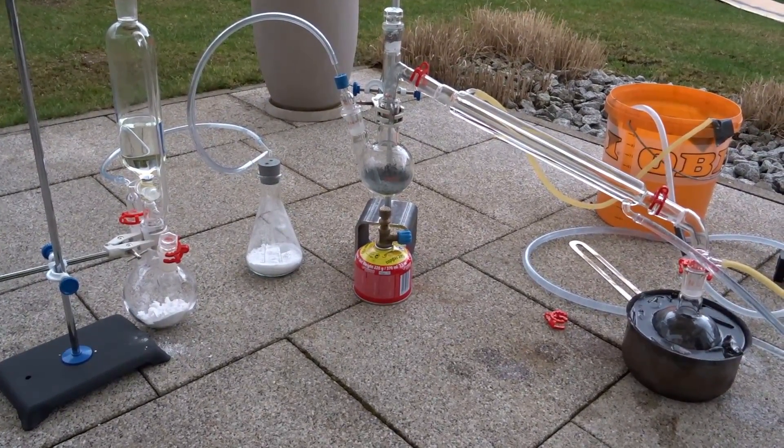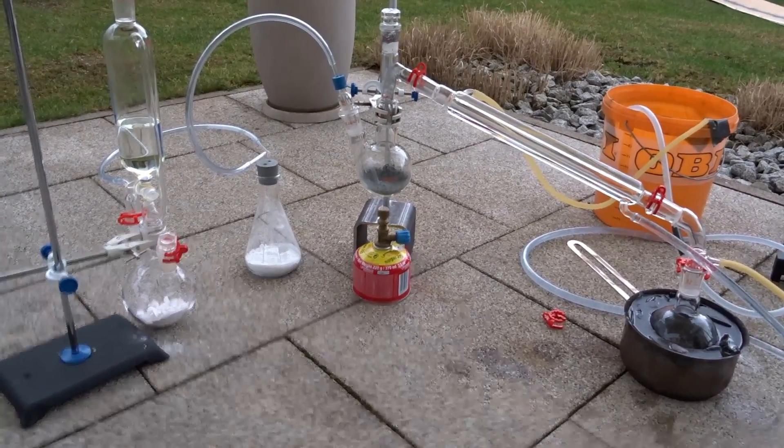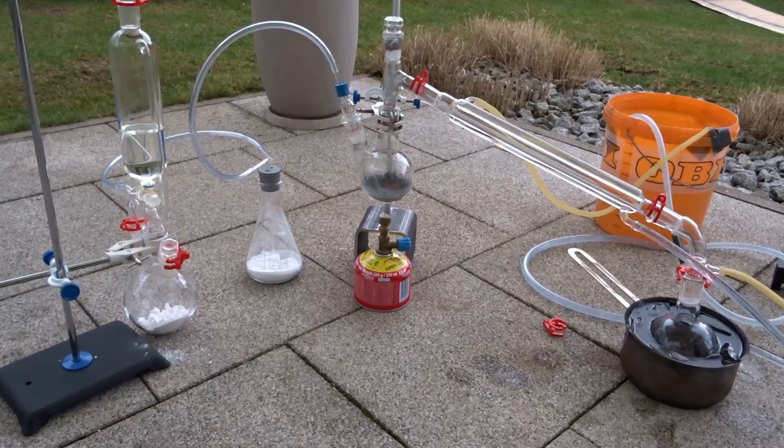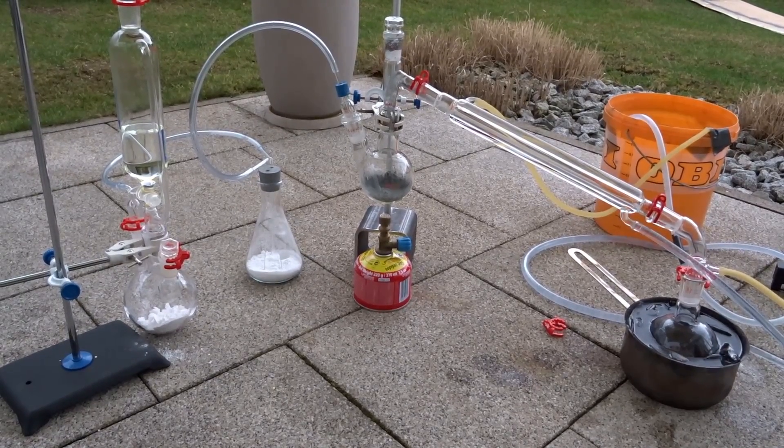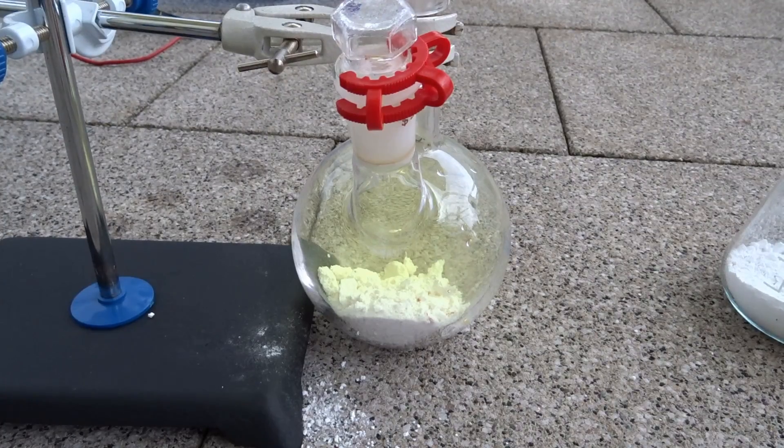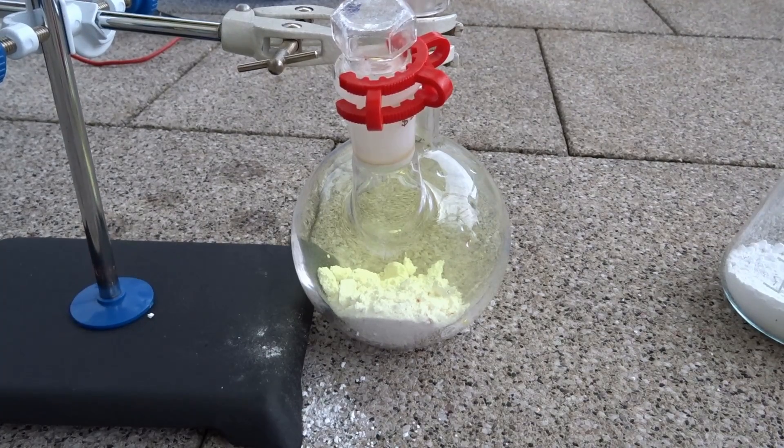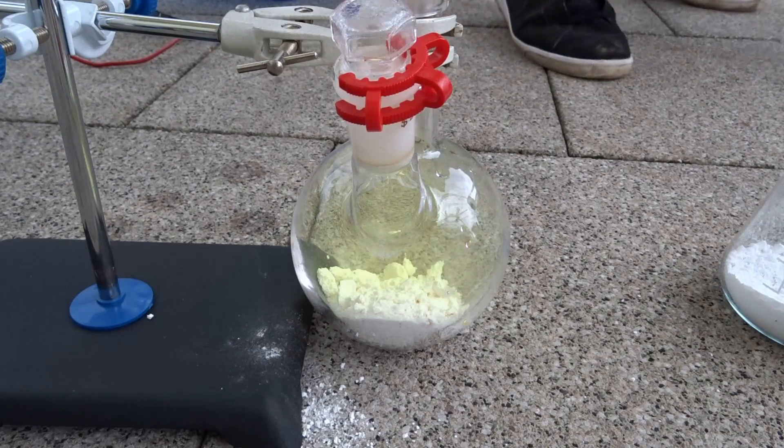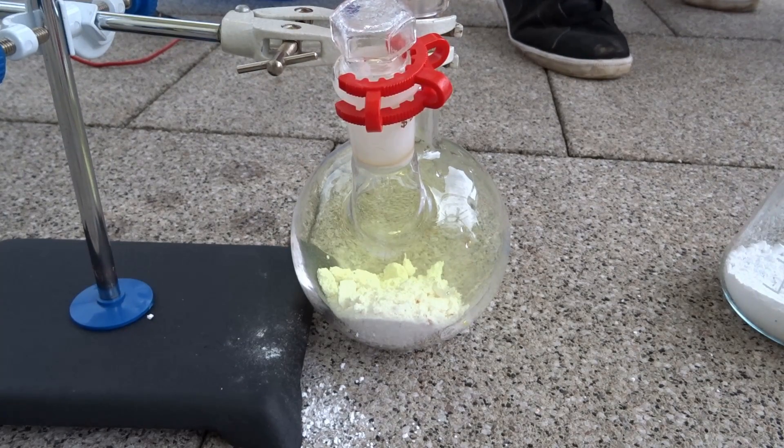And before this I've already made the aluminum isopropoxide, but this didn't work out at all, so I tried with silicon dioxide. And the first idea I had was to do this TEOS, so I set up chlorine generator, I set up Bunsen burner under the silicon carbide.